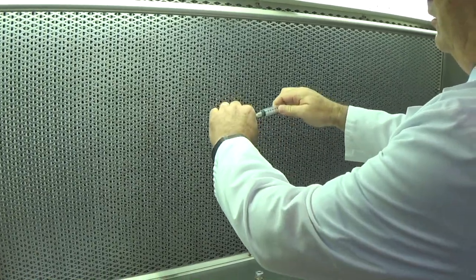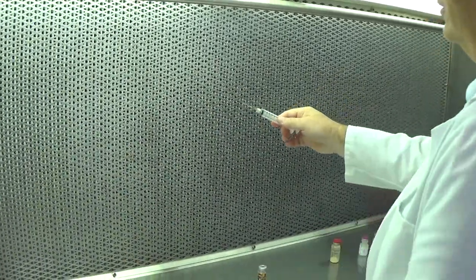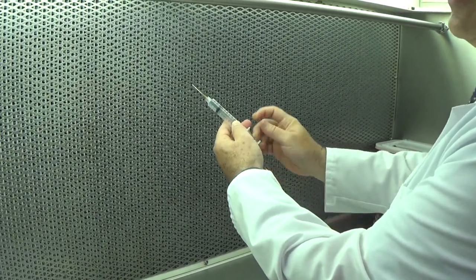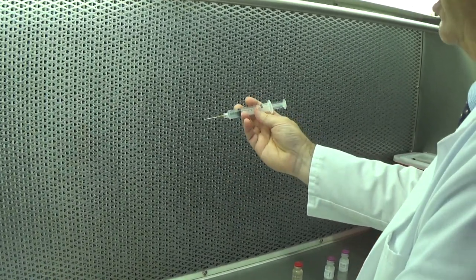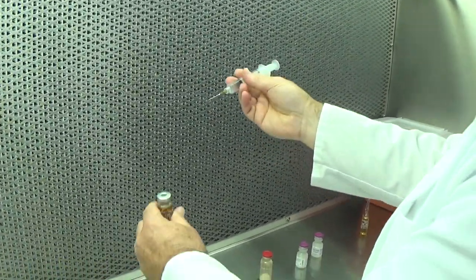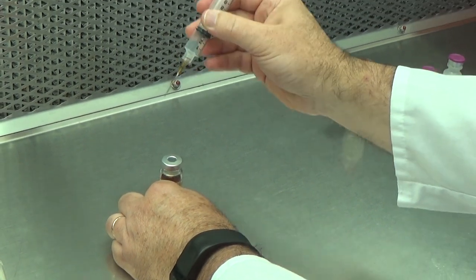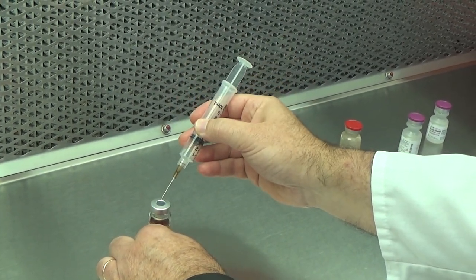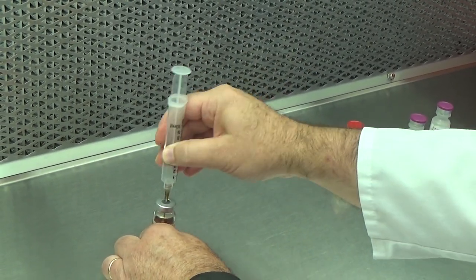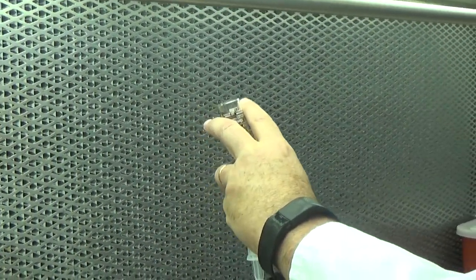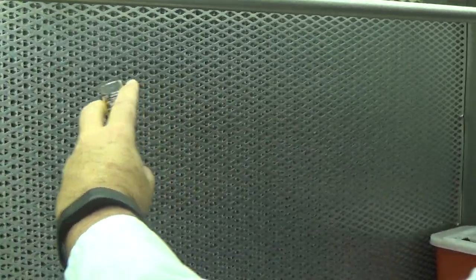I'm going to make sure my plunger moves freely. At this point, I'll remove my needle cover. And I'm going to choose some replacement air, something less than the 5 milliliters I'm drawing up. I keep the bevel vertical as I enter the vial.